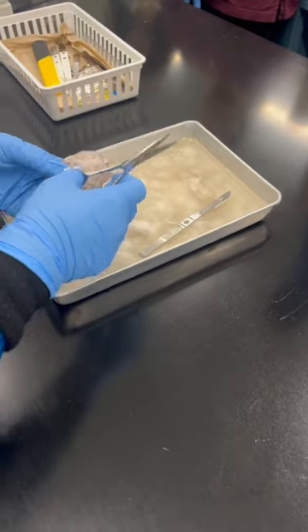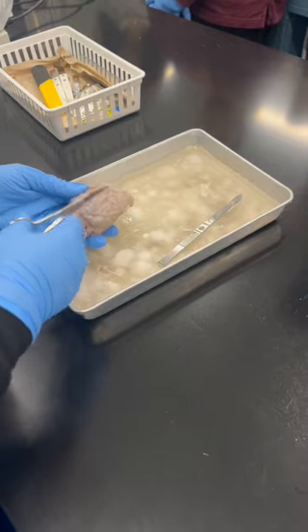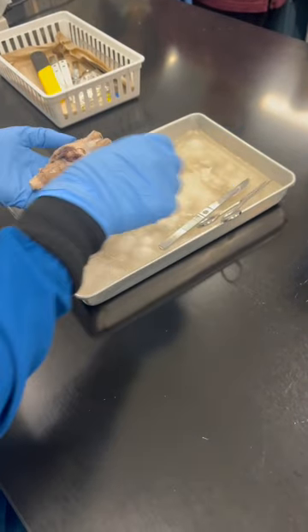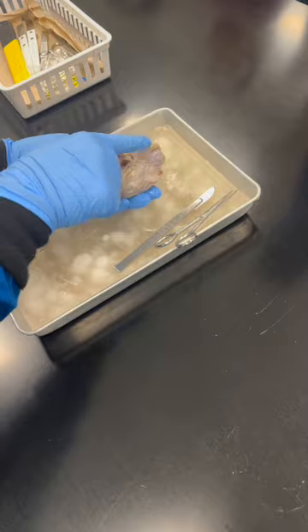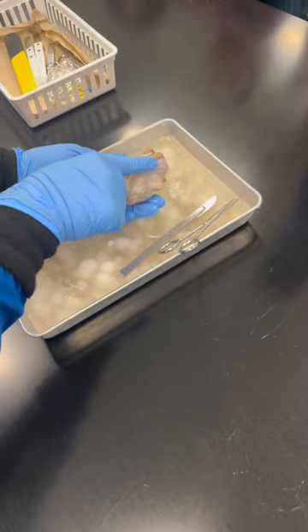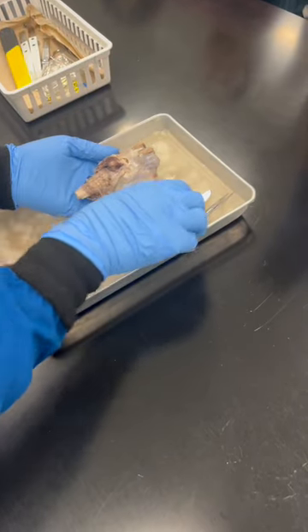So we can cut it. I'm going to cut this brain structure longitudinally. Some of these layers we can take out. Oh, before that I wanted to go here. These 2 structures on the dorsal side, can you identify those? That is a cranial nerve. What is that? Olfactory nerve. Then we're going to see the optic nerve.